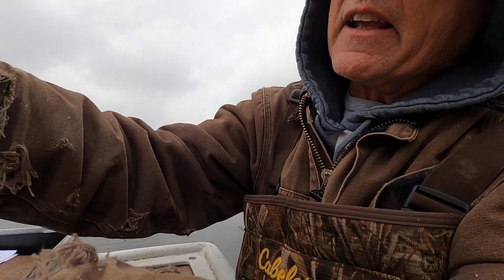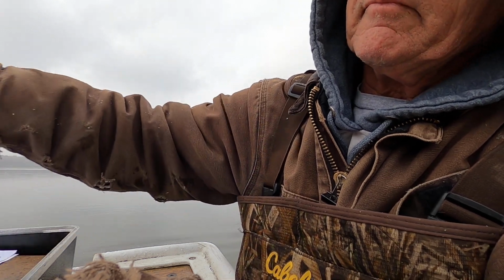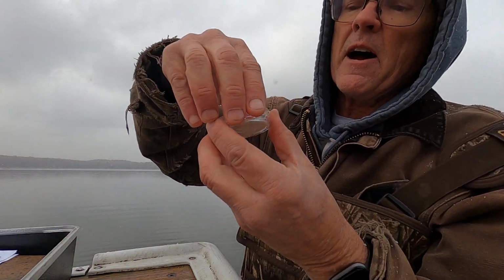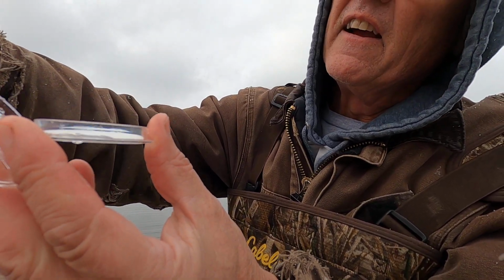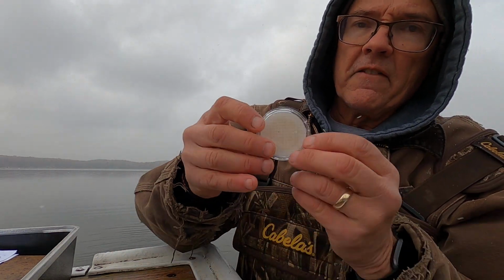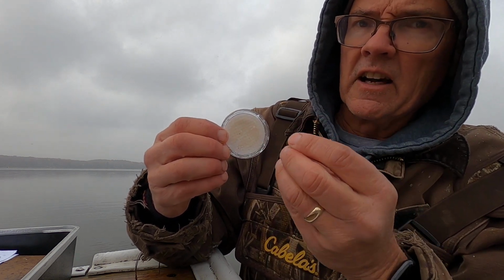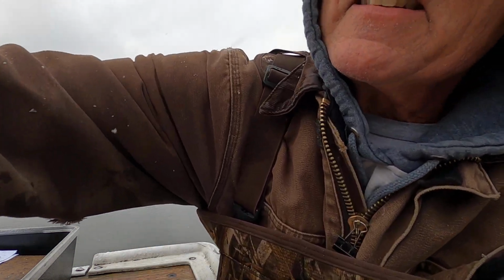So all I care about is my filter paper. This is a little petri dish. Take the top off like this. Take my filter paper off. Not sure if you heard that. So now you might be able to see it's a little bit yellow in coloration compared to the edges that were trapped in the petri dish. And now this is kind of the cool part.